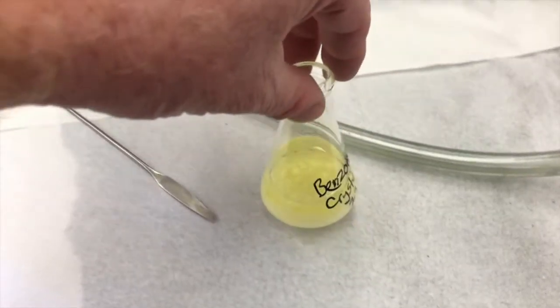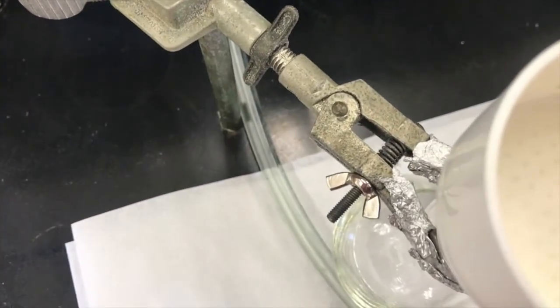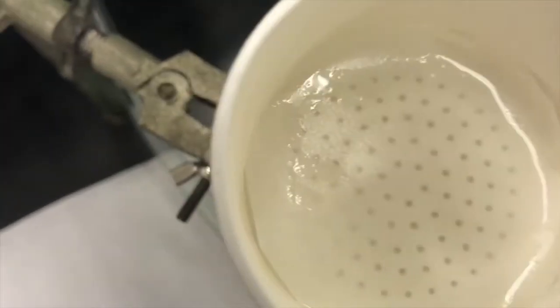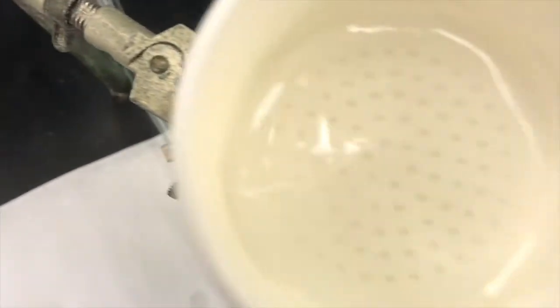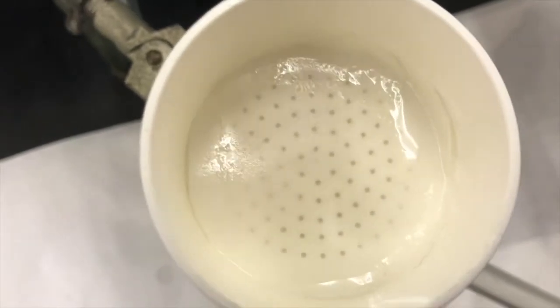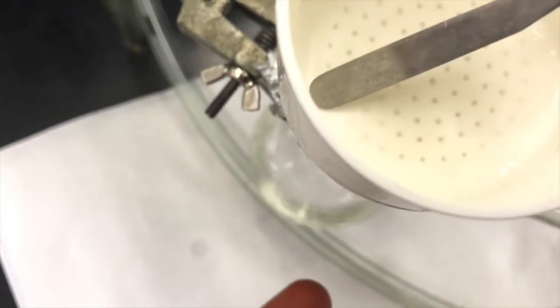And I've got my crystals over here ready to go at room temperature. I'll first pipette some cold ethanol onto my filter paper so that when I turn on the vacuum it sucks down well and it gets me a good seal, because I don't want those little plastic holes to be open for the filter paper to be lifted up so that the solid can get around the little plastic holes. So here we go. I'll turn on the vacuum full blast here. You can see it start to suck down. Might even push it down a little bit in the corner here.